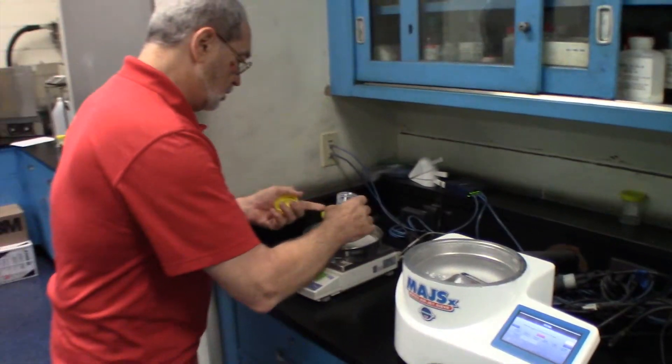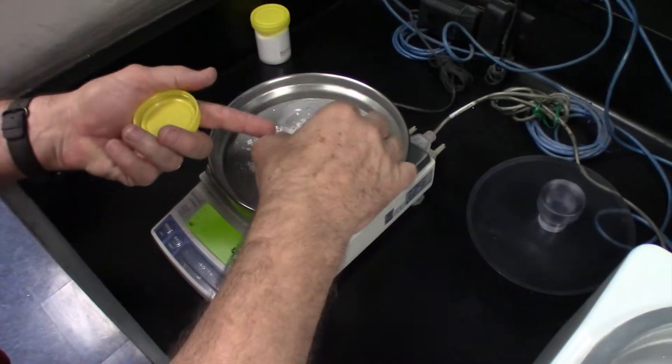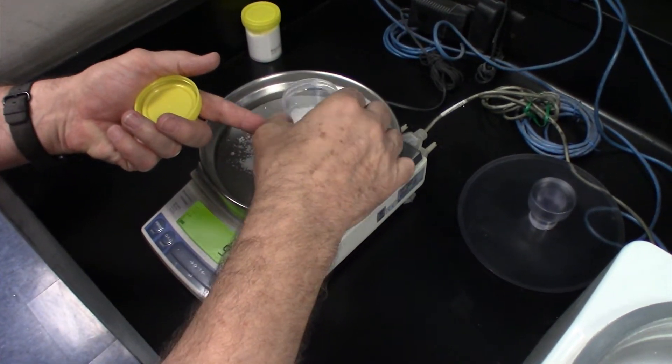Now, what we'll do is put a sample on the screen, and we're going to try to use close to 10 grams.